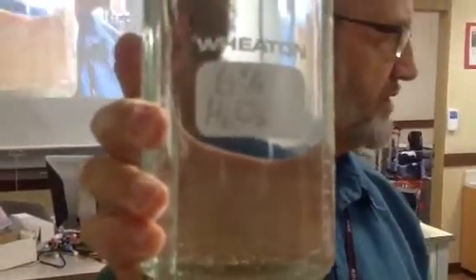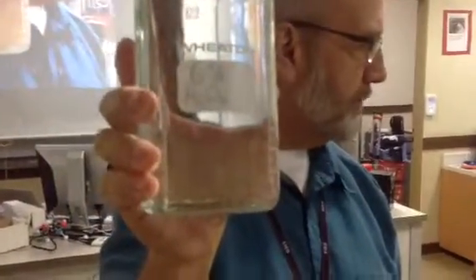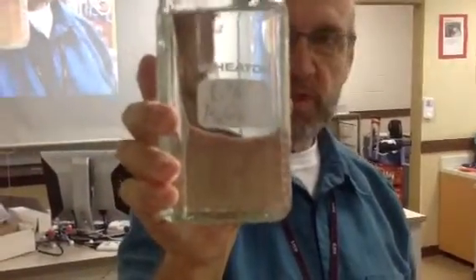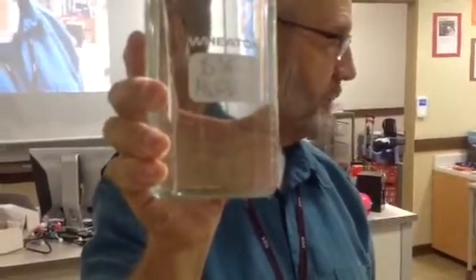That is a bottle of water. Not real exciting, okay? This, however, similar but bigger bottle, is hydrogen peroxide. 6% H2O2, hydrogen peroxide. I'm sorry I wrote the label as a chemist. Should have written the words hydrogen peroxide instead of the formula, but you'll have to deal with it, okay? I've diluted it down to 6%, but it's ready to go, okay?